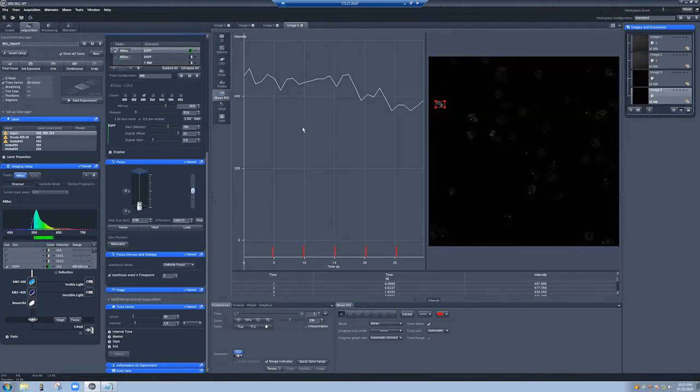However, if this is going down kind of dramatically, then you can get a situation where you really do need to worry about the bleaching. Also, we imaged 30 images. If we had gone for much longer, so more images, this slight trend, a slight decrease in intensity, becomes a big decrease in intensity, and then we have to start worrying. In any case, the fact that this didn't happen in this particular sample is fine, but I've shown you the tools with which to evaluate whether it's happening in your sample.